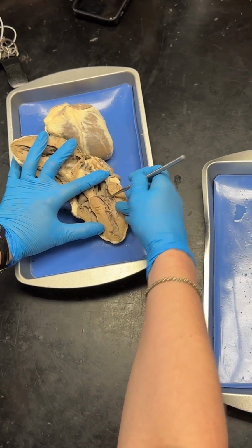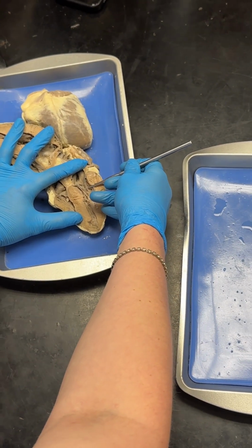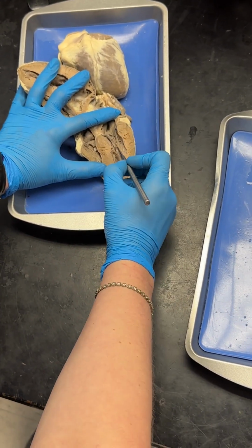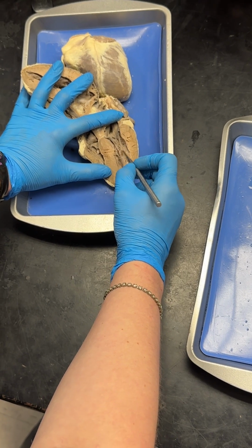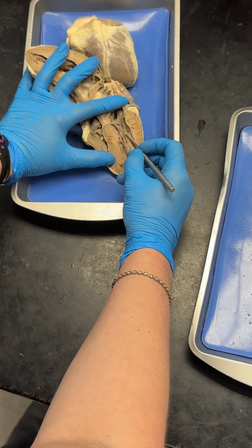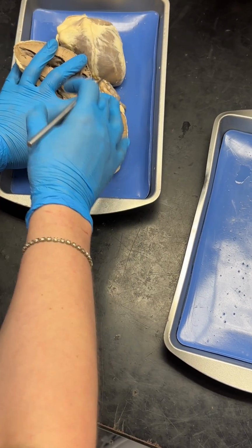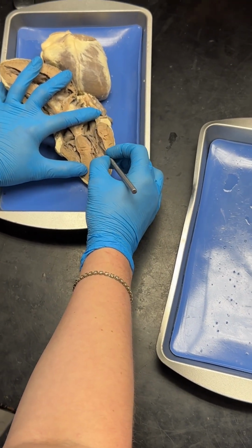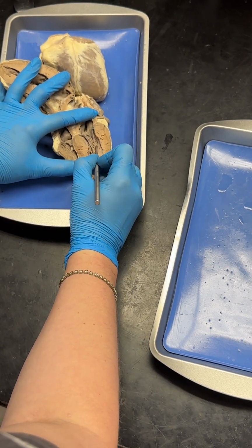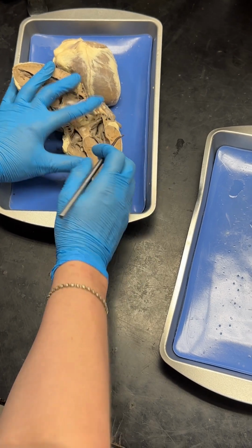But connecting those valves, you can see all these fibers. These are your chordae tendineae. I've got them underneath the probe, and these connect the valves with the papillary muscles inside the heart. This is not a structural muscle, meaning these muscles don't look any different than the other parts of the heart under a microscope, but they connect to these chordae tendineae, and that's why they have that special name. All of these bumps where the chordae tendineae attach are the papillary muscles.